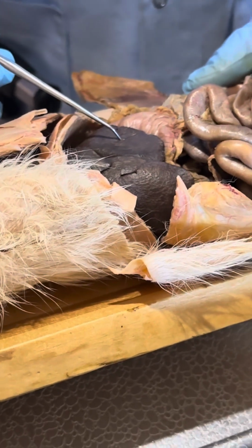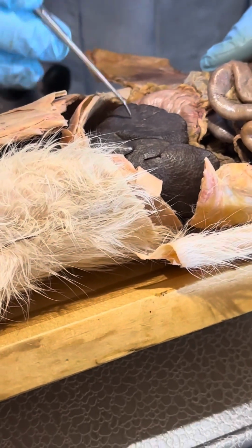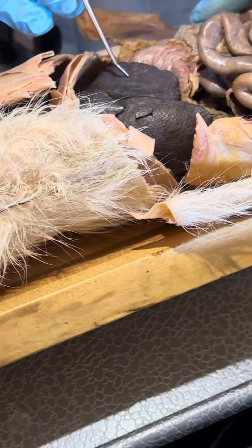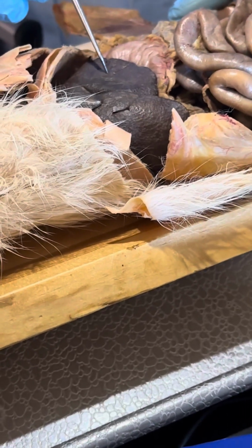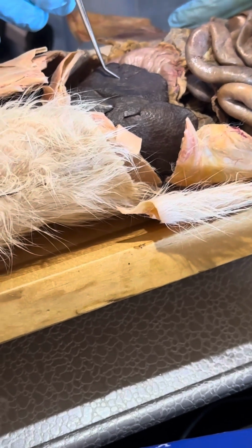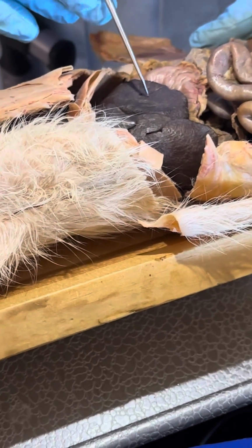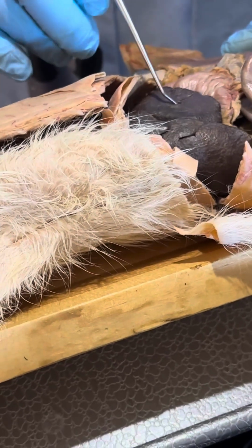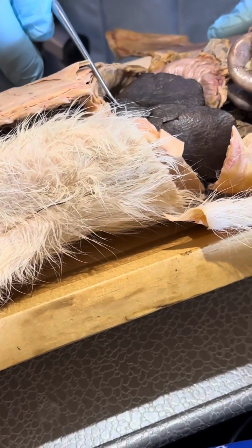So this is the left lateral. And if you're writing this on an exam, just so you know to get full credit, you wouldn't just say left lateral lobe. You should say left lateral lobe of the liver, because other things have lobes, right? And I've had people tell me that these are lungs. These are not lungs down here. Those are livers, right? So left lateral lobe of the liver, left medial lobe of the liver.